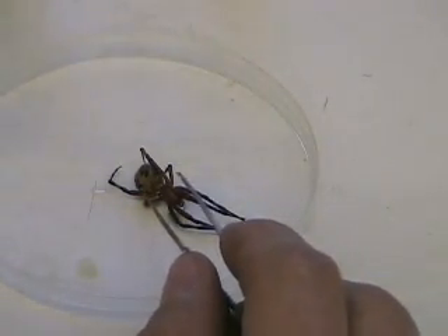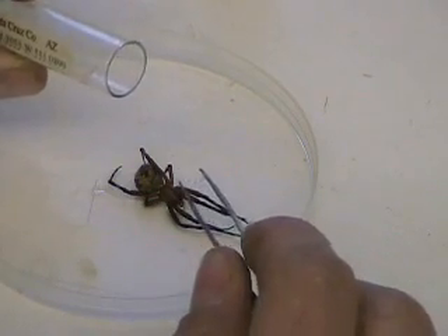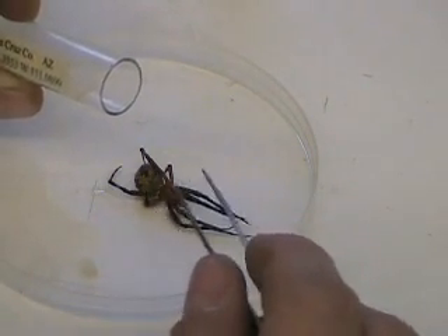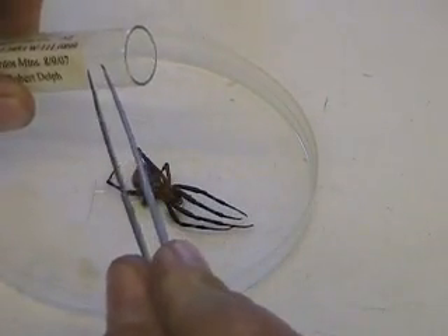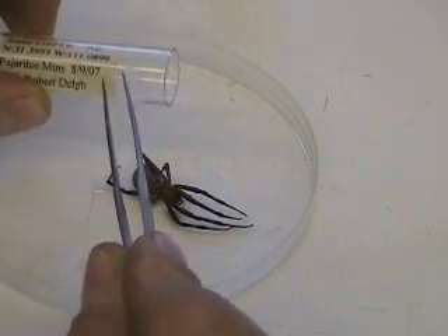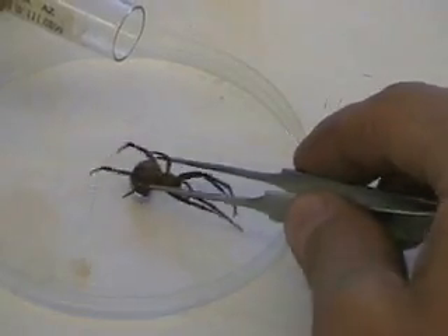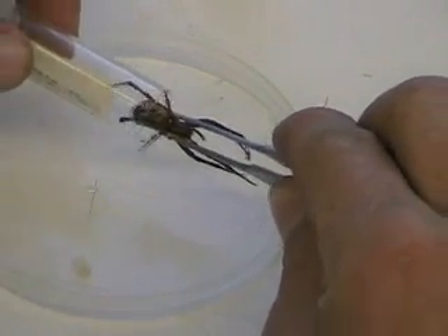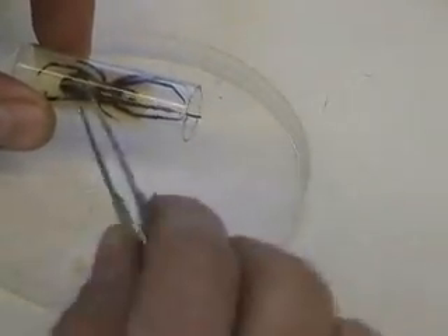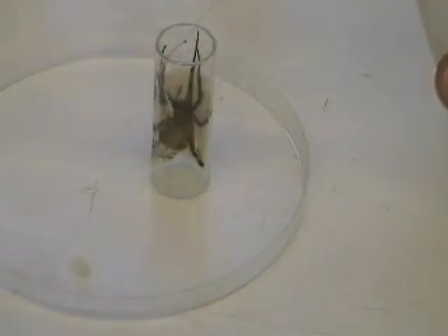It really doesn't matter how you put the spider in the vial. I want to use a one dram or two dram vial depending on the size of the spider. Even a tarantula should go in ethanol — that requires a big vial. When doing your collections, I recommend trying to get small spiders, as very large dram vials for something the size of a tarantula are expensive. When putting a spider in a vial, make sure the legs are kind of straight. I like to put the spider in so the dorsal side is exposed and facing upward — this gives you a good specimen for identification in a reference collection. Then I fill with 70% ethanol.